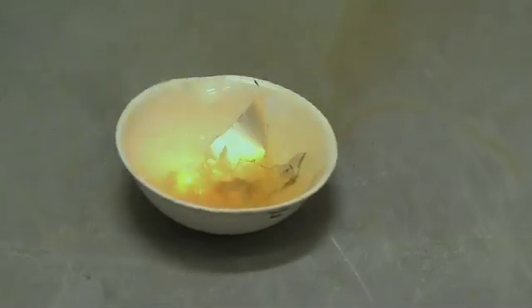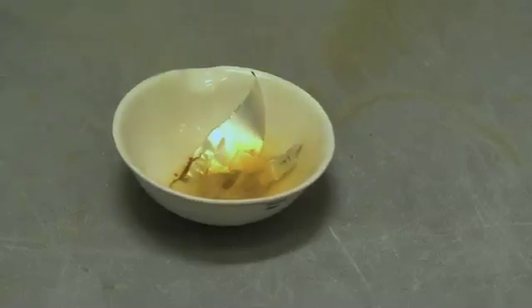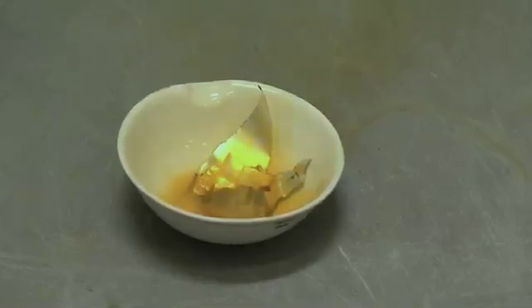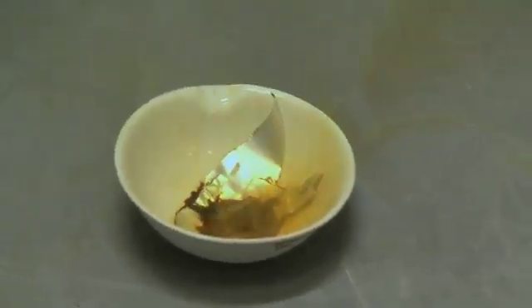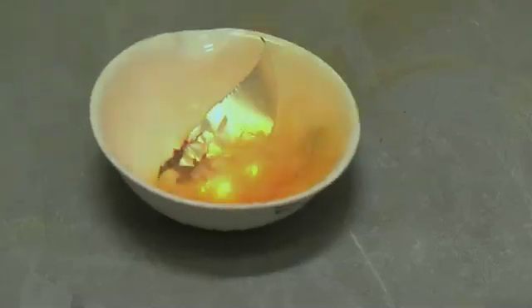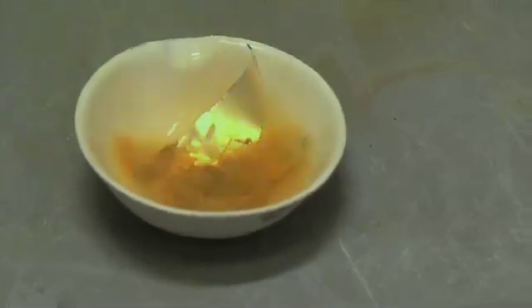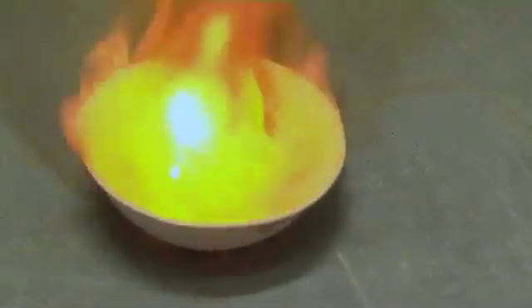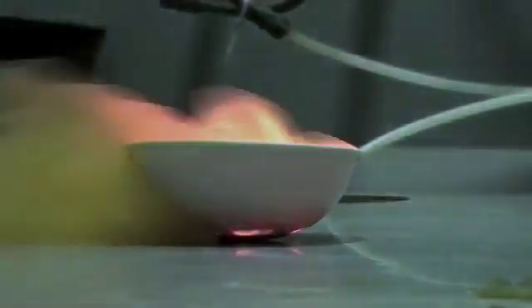So here we see the exothermic oxidation and formation of aluminium tribromide. The reaction is strongly exothermic, which means it gives out energy, and that energy then evaporates off excess bromine, which you can see coming off as vapour. A wonderful exothermic reaction — very, very fast and rapid — forming aluminium tribromide.